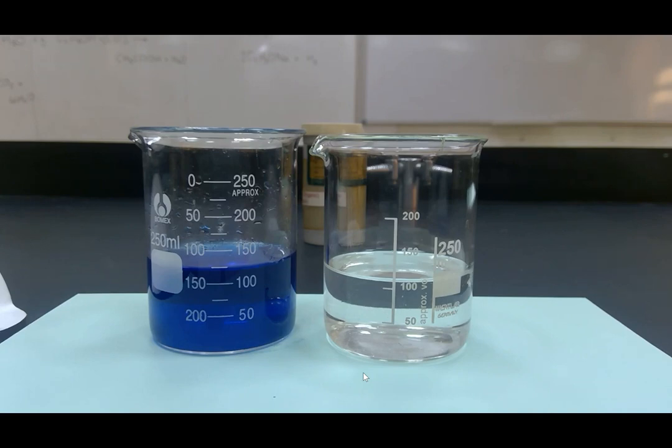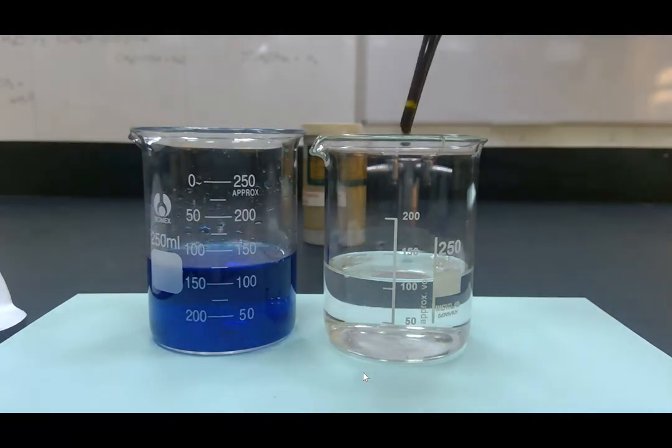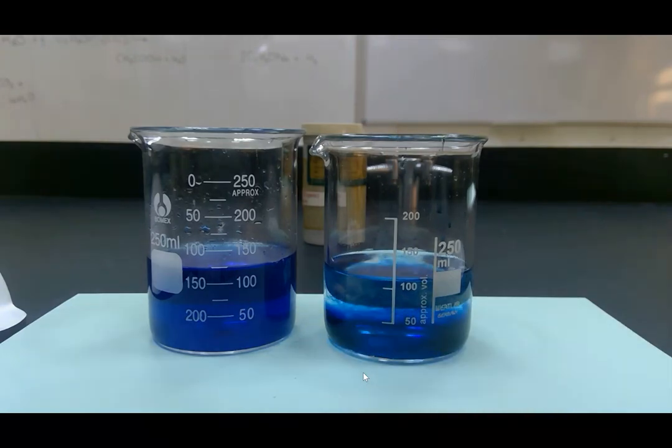Also, the sodium ethoxide, which is the product of the reaction of an alcohol, ethanol, and sodium, is also a strong alkali, and so we should find that it also turns blue or purple when you add universal indicator to it. So you cannot tell the difference between these two reactions by testing them with the universal indicator. That won't work because they both form alkalis.